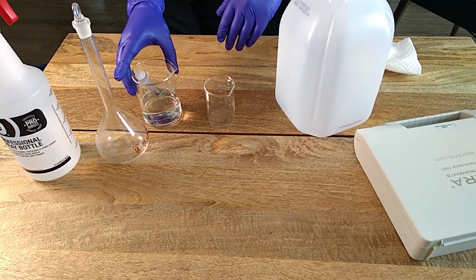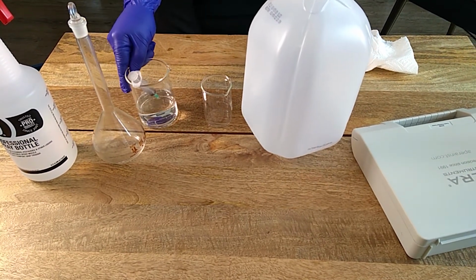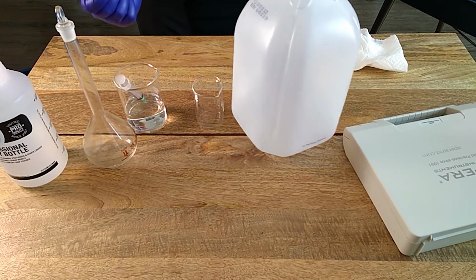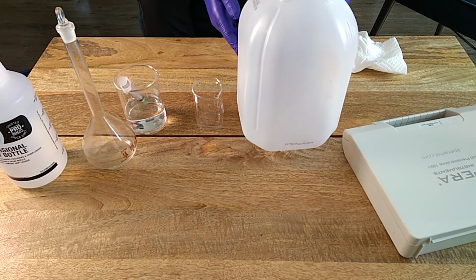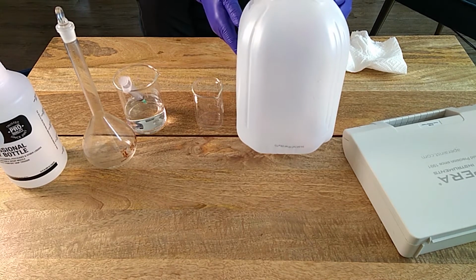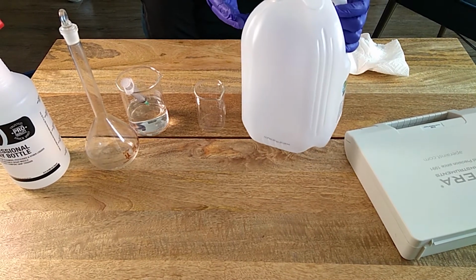So let's say you want to prepare 1 gallon using a concentrated solution. You'll take whatever the manufacturer says, put it into 1 gallon, and then fill that container up to 1 gallon. But how do you do that? How do you ensure that the volume that you get is actually 1 gallon? For example, this is a 1 gallon container. So you might think, well, I just fill this up and it's 1 gallon.